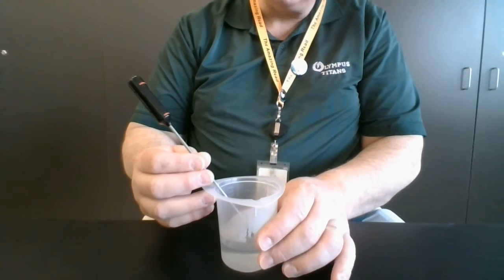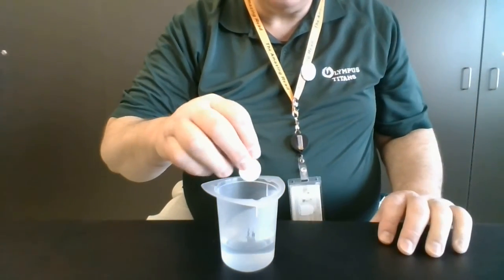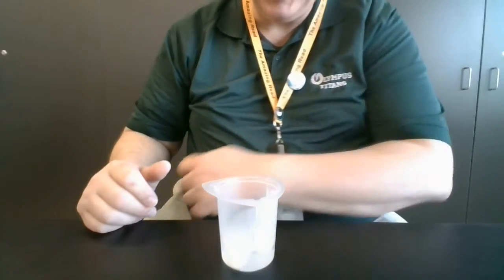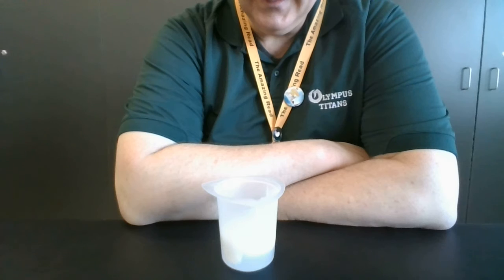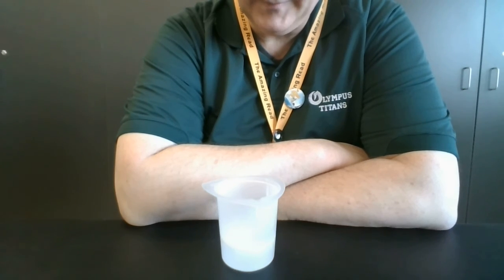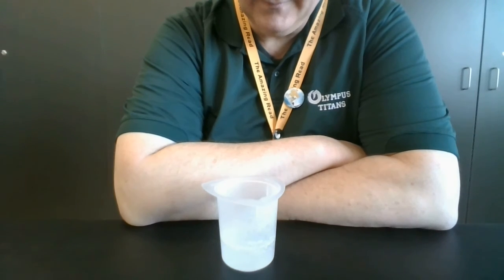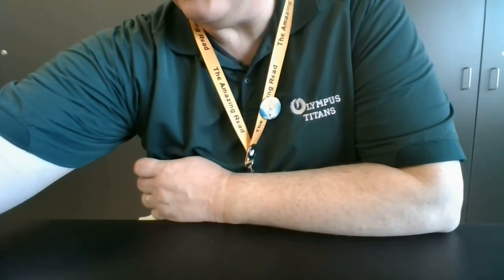All right, finally, I have some water that I heated up in the microwave. And this one, it was boiling when I put it in, but it's cooled down. It's now at 55 degrees Celsius. And we'll drop it in 3, 2, 1, drop. And that is really going to town. Done. Stop timing.